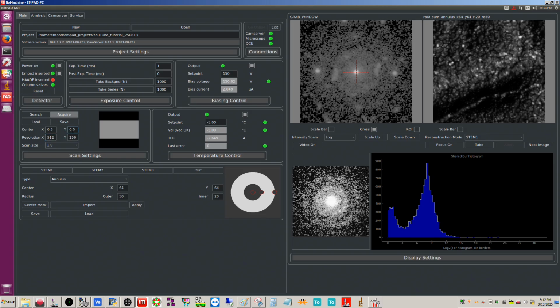And then if I wanted to, I could shift this up so it's only scanning the top half as opposed to the middle, okay? Or I could go down further, and now it's scanning the bottom half, okay? So again, this is 0.75 Y relative to the upper left corner here, okay? So you can use that.